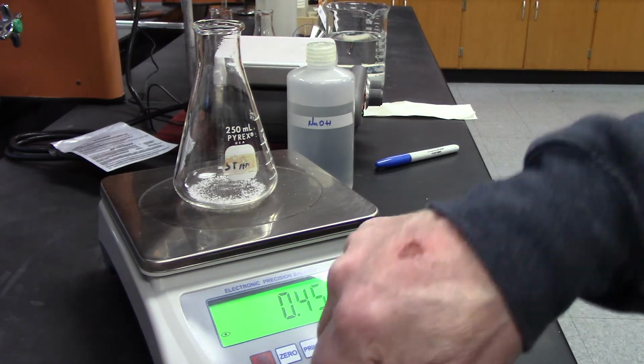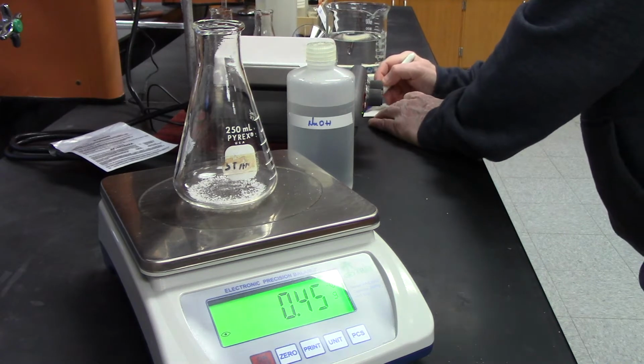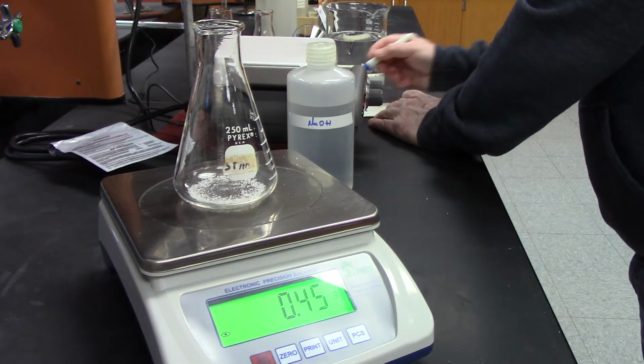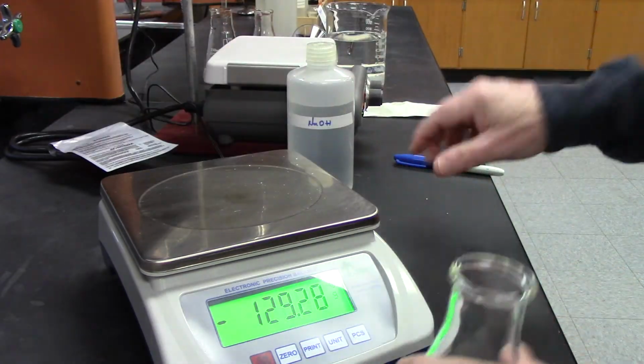Okay, number 3 is 0.45. All right, so number 3.